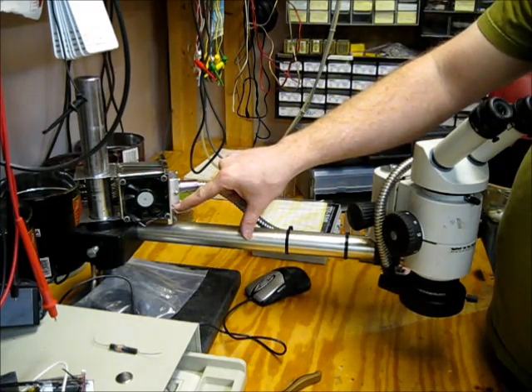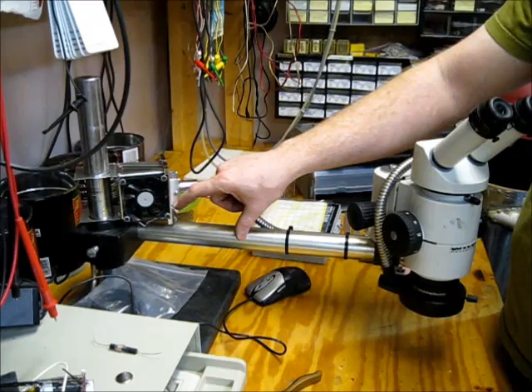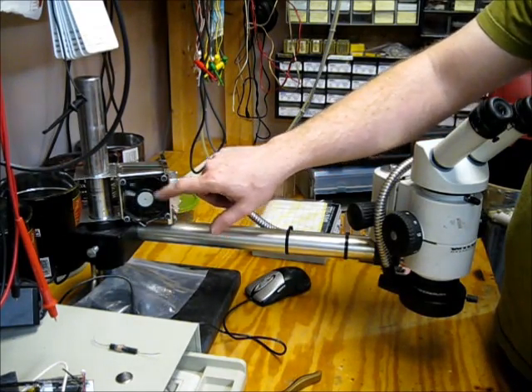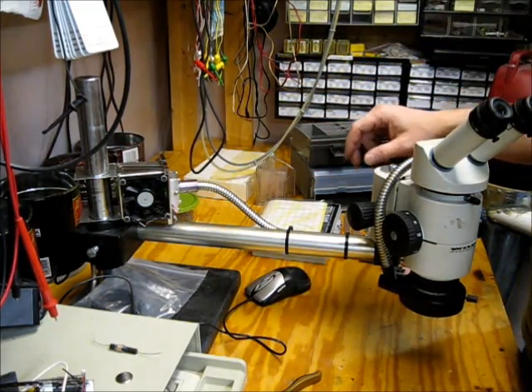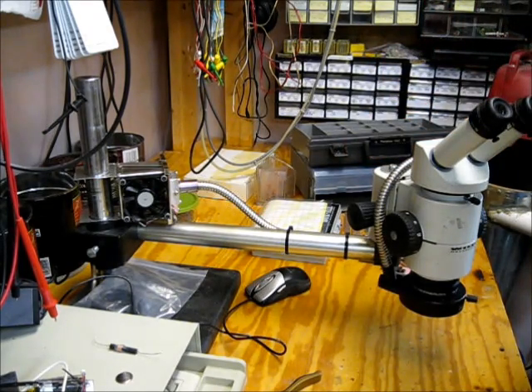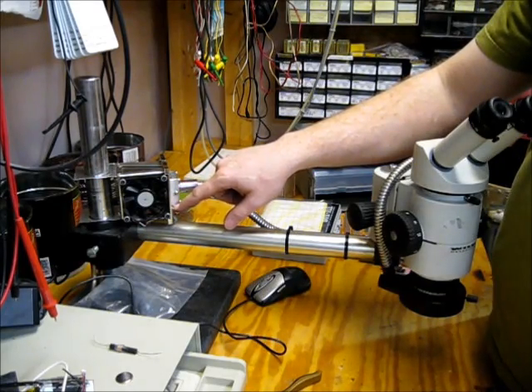On this little pin strip here on the card, there's one pin that's just a toggle on-off. When the light is on, the IO is high. When the light's off, the IO is low. This fan running at 12 volts is a screamer. This is sort of an odd-sized fan, so I couldn't find a quieter one in my junk box to replace it with.